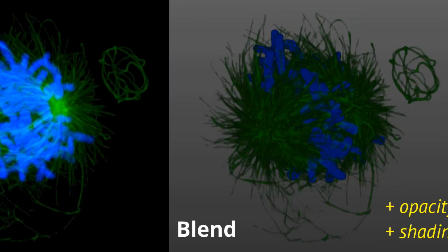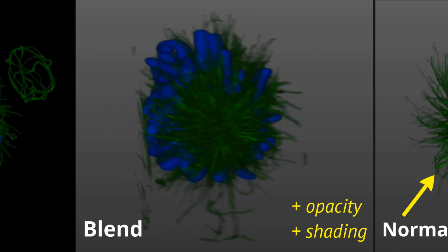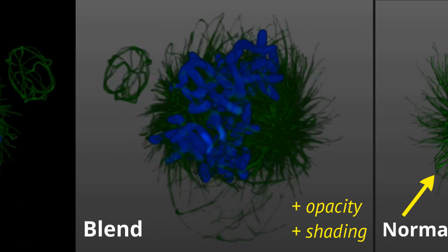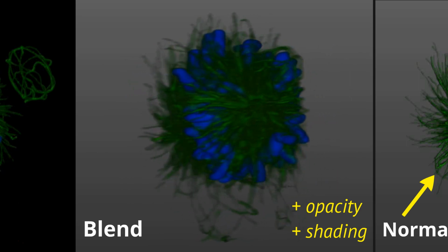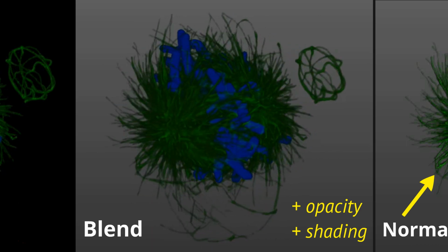So the next one I want to point out, and for some reason it's really dark, it's a lot brighter on my screen, you'll just have to take my word for it. This is called a blend. It's also referred to as an alpha blend. We did not invent it, but basically this technique does a couple things. It adds opacity to the data set. That opacity is based on the intensity value of the voxel. We also apply shading, and those two things together give you the illusion that it's no longer a flat structure, but that it has some 3-dimensionality, okay?